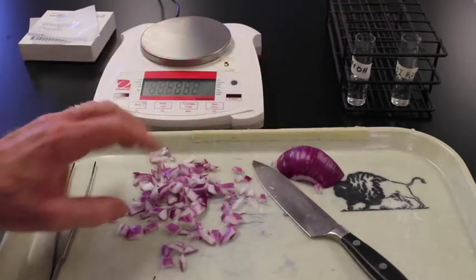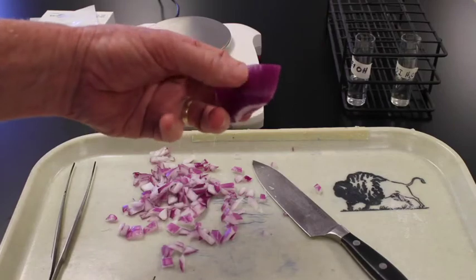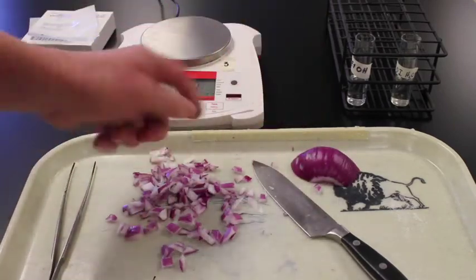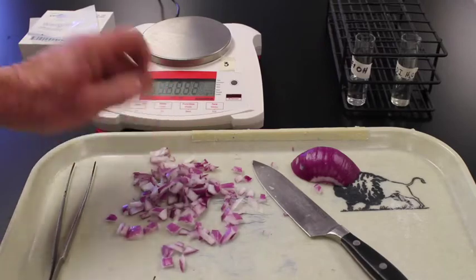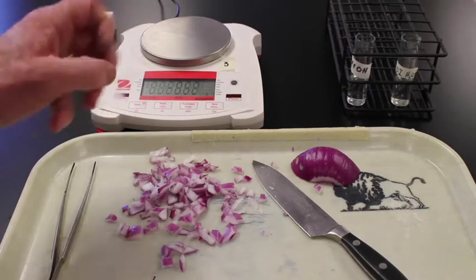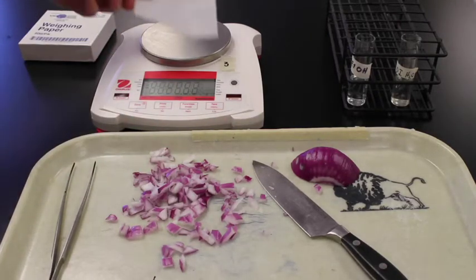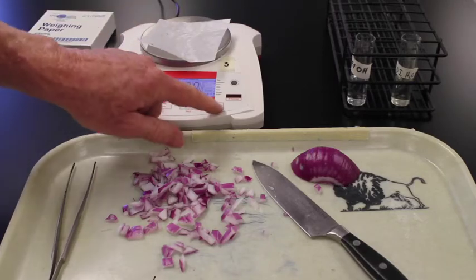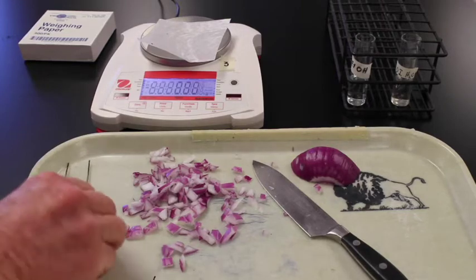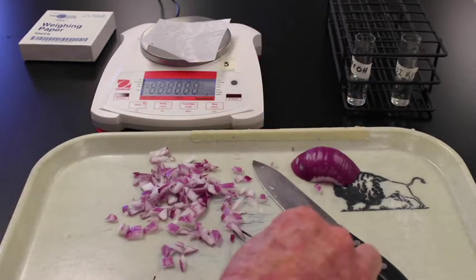I've taken an onion and I've cut that onion into small pieces. So this is our original onion piece. It has plenty of pigment. Then I cut it up into small pieces that have both white and purple parts in them. I tried to make the pieces pretty much the same size, but you can see that there's slightly different sizes in there. I'm now going to weigh out approximately 6 grams of onion tissue, place it into each of these two solutions.